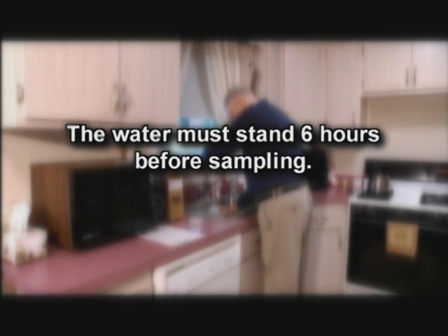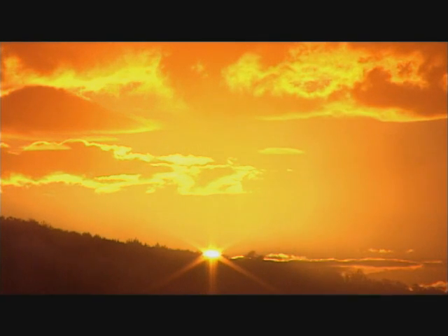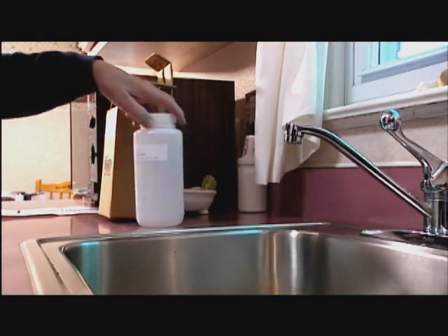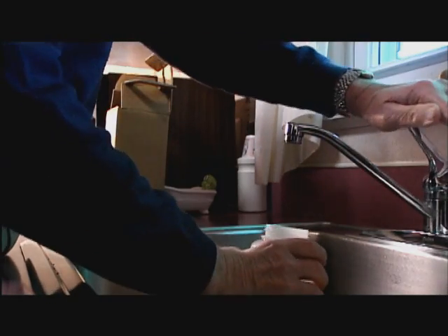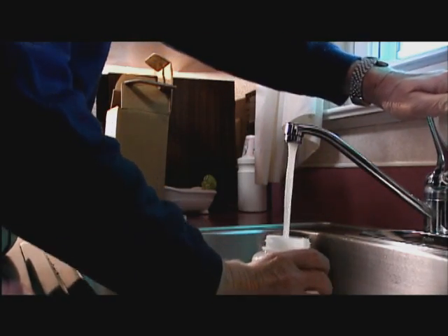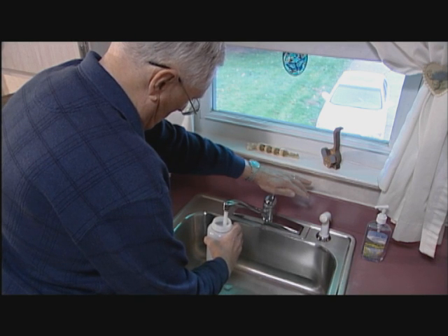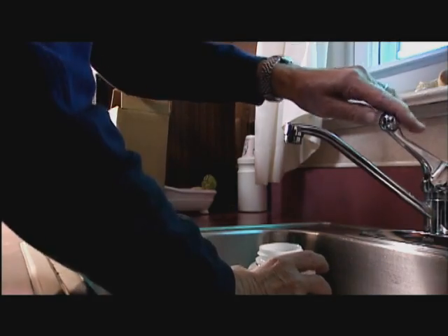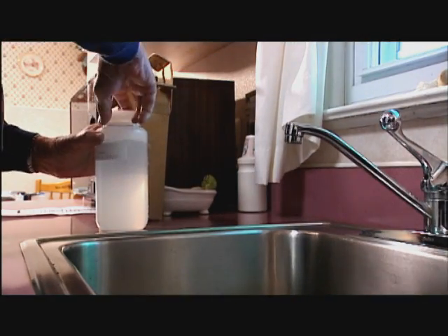The water must stand six hours before sampling. Sampling first thing in the morning often works best. Take a one liter sample bottle, remove the cap, and make sure it does not get contaminated. Place the container directly below the faucet and open the cold water tap. Fill the sample bottle to the one liter mark on the sample bottle. Don't overfill. Cap the container and turn off the water when finished.